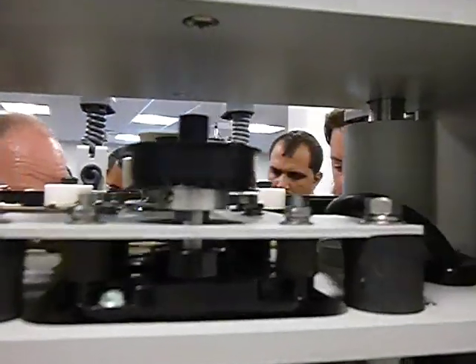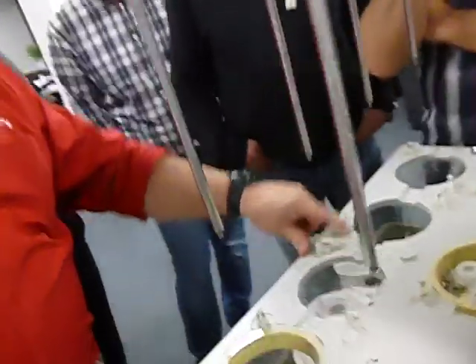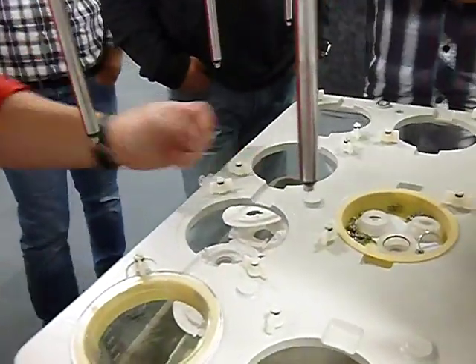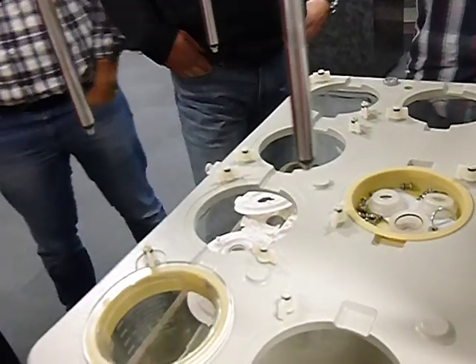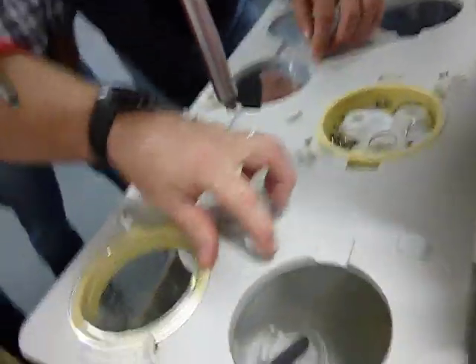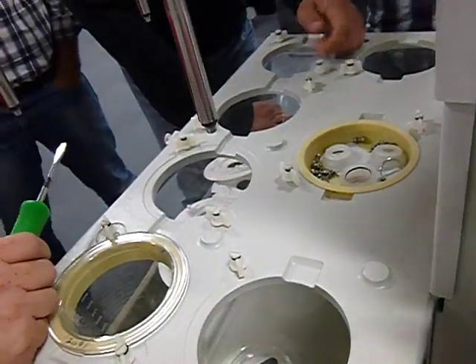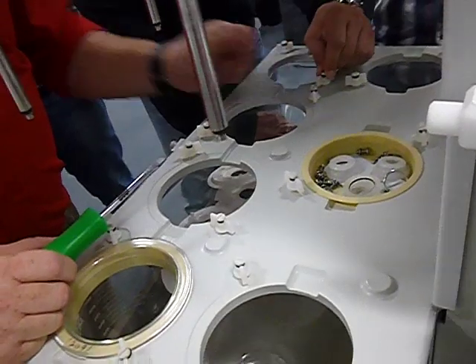So again, like I said, you can inspect each one of these, and ideally it should spin around without that center nut moving. If that center screw starts moving around, take it off, back the nut off on the back of it a little bit to where it works like it should, and then it should be fine. Again, as I talk, what about this one? This one needs to be tightened a little bit.